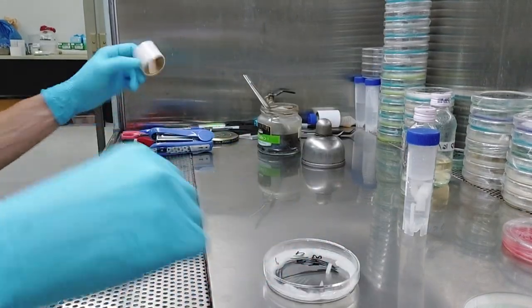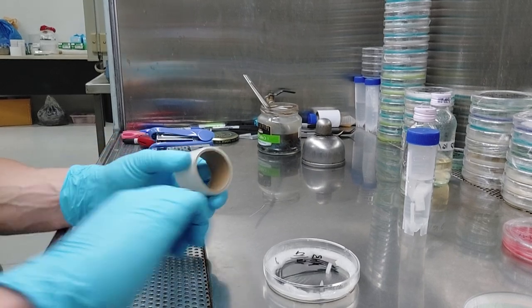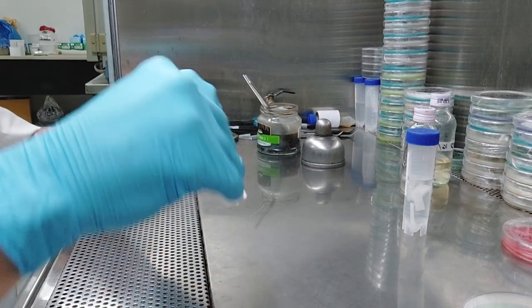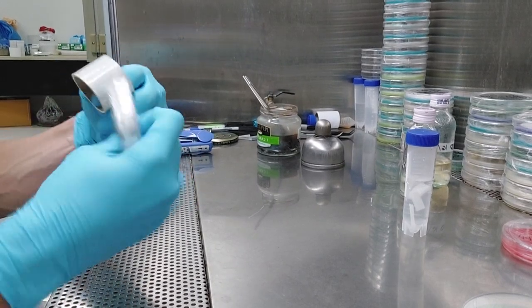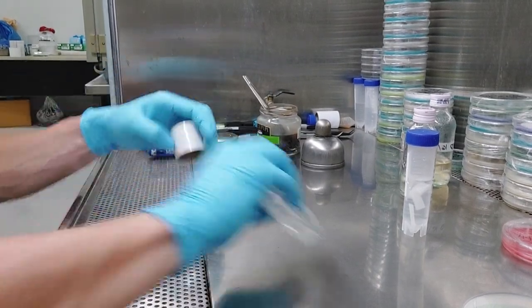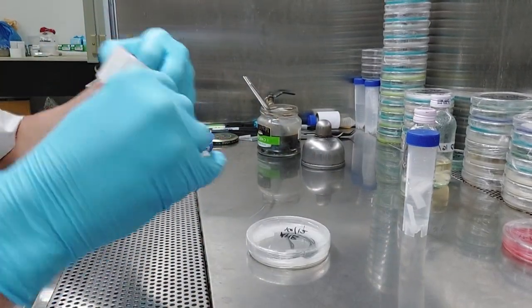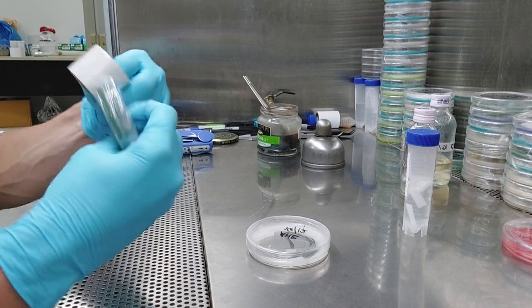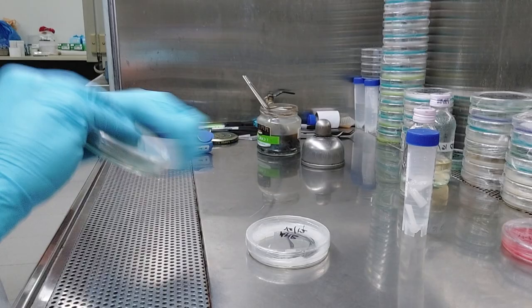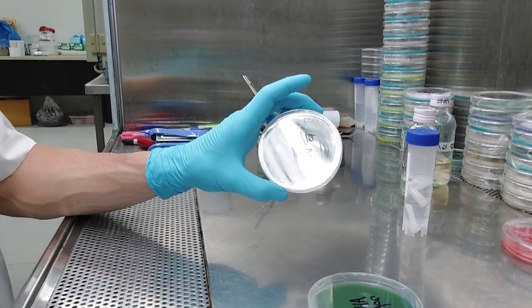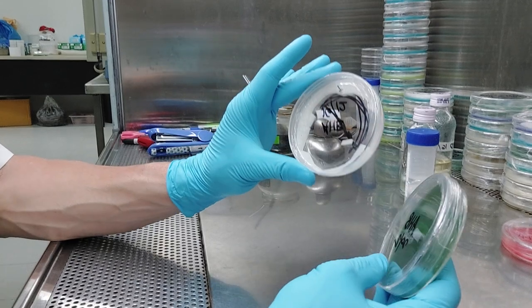Now notice I didn't touch, hopefully, and I have not contaminated. You know, this is where all this stuff would have taken me like a minute, minute and a half tops. I'm going to wrap this up and I'm going to save the old plate. I see a lot of people throwing plates away and I don't know why because, you know, throw them in a garbage bag, but don't throw them away. Don't throw them in your garbage. And also, you know, the garbage man sees some weird stuff like this in your garbage every day. They might get like a little suspicious, you know? So if you're going to throw these away, you guys, especially if you live in the States, you know, it's like clippings from your indoor garden. You don't throw them in the garbage, right? Especially because you got nosy garbage men.